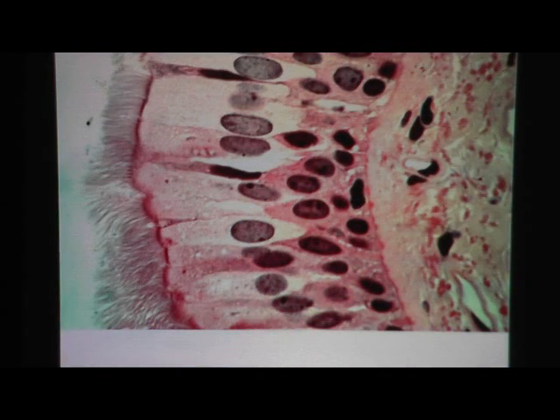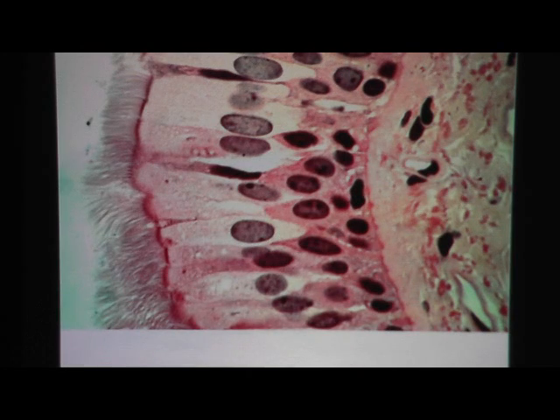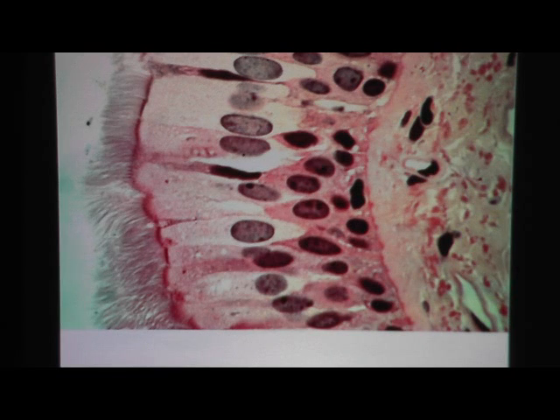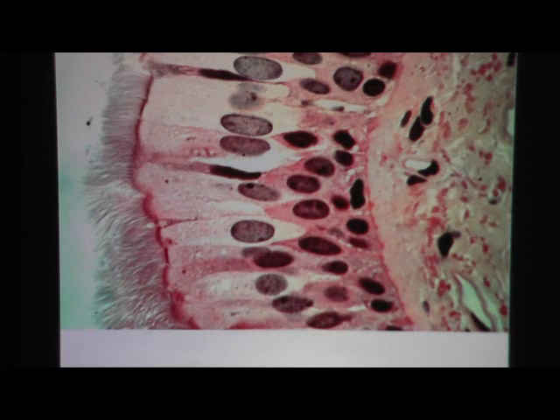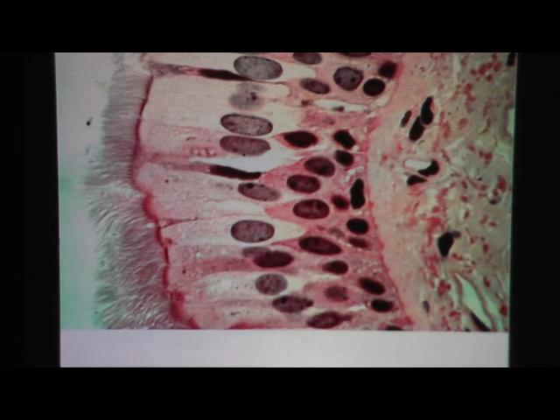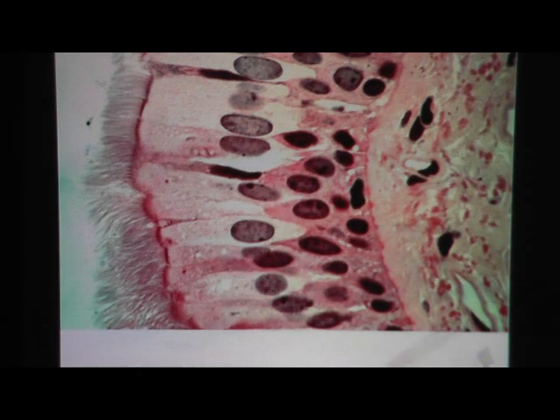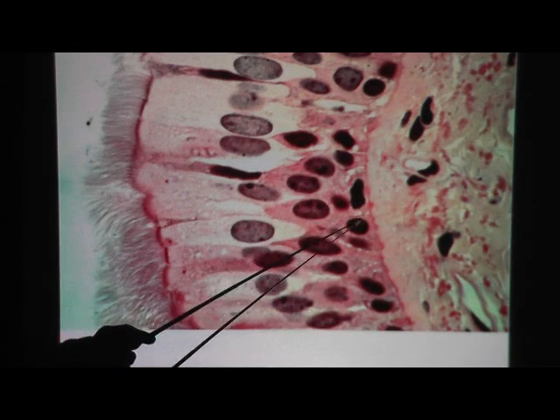At high power again, you see clearly this is epithelium — the wisp of cilia and individual strands. You can see the nuclei. This would be the nucleus of a columnar cell, so this is pseudo-stratified ciliated columnar epithelium. If we ask you to name the tissue, the best answer is ciliated pseudo-stratified columnar epithelium — the words don't need to be in that exact order. Name the cell: columnar cell. Name the dark structure: nucleus. Name the pink stuff: cytoplasm.